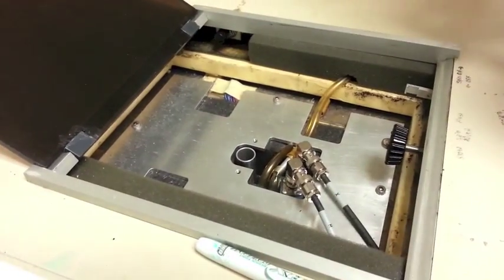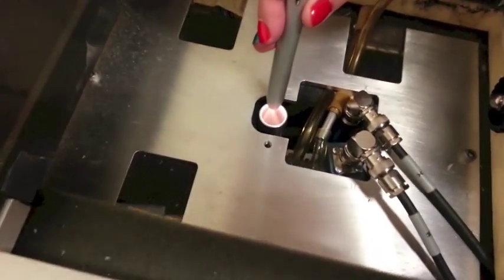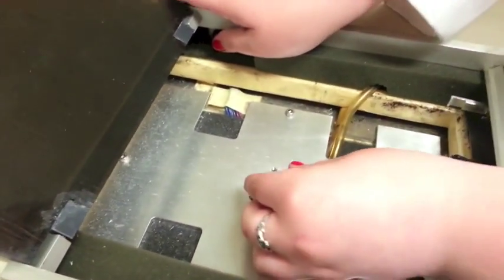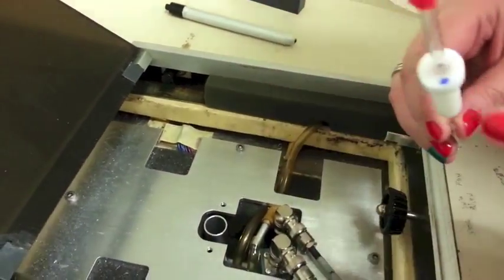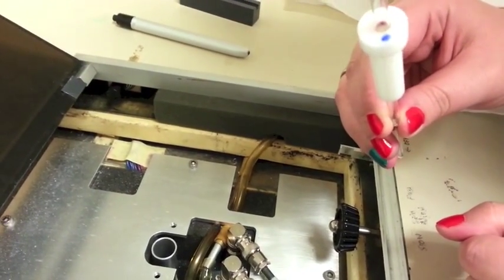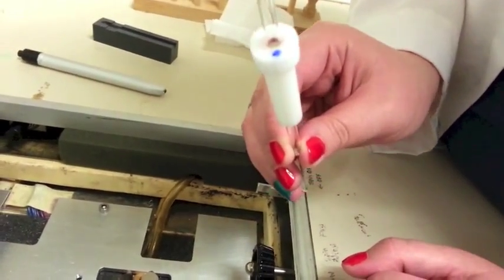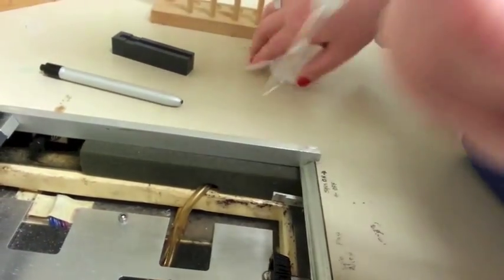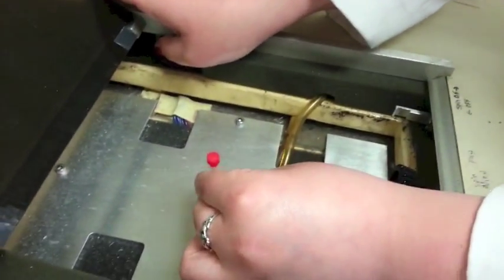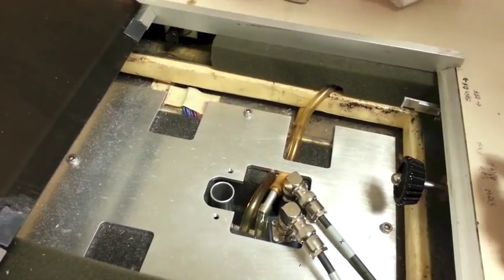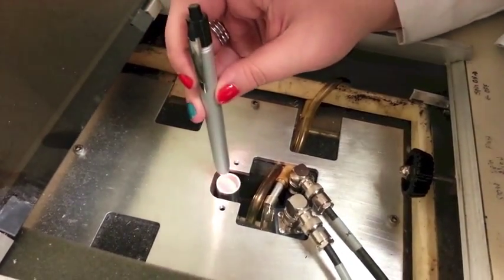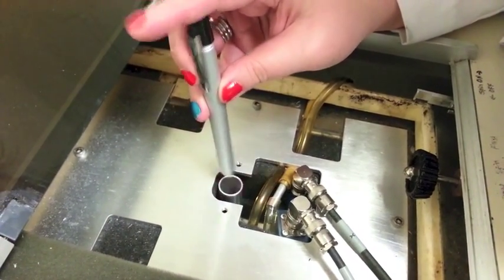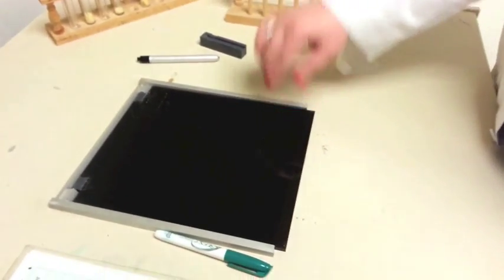The last thing you want to do is check that your sample is spinning. You'll notice on the bobbin, there's a sharpie mark. If you can see the sharpie mark, that means your sample is not spinning. If you can't see the mark, that means your sample is spinning. I cannot see the sharpie mark, so our sample is spinning. You're all set to take your scan.